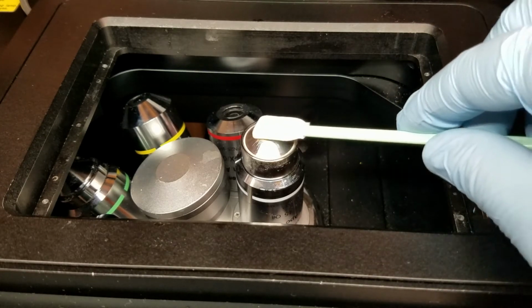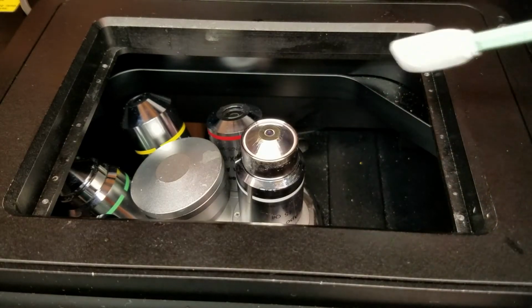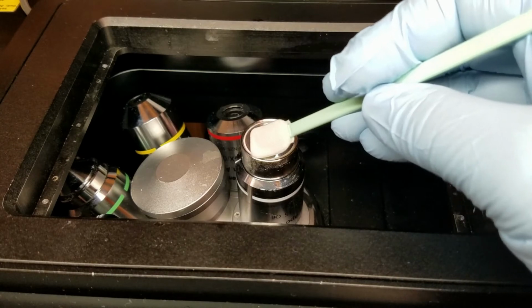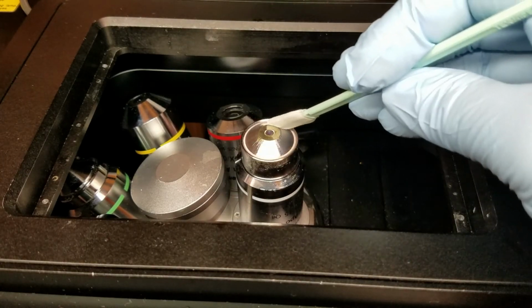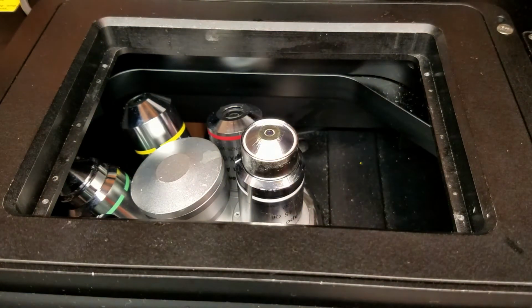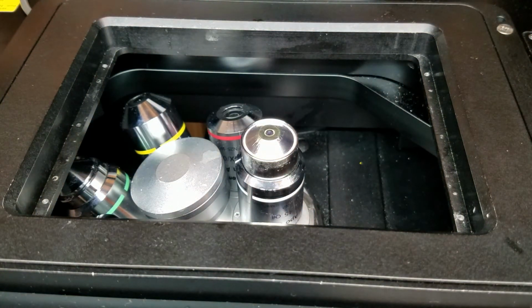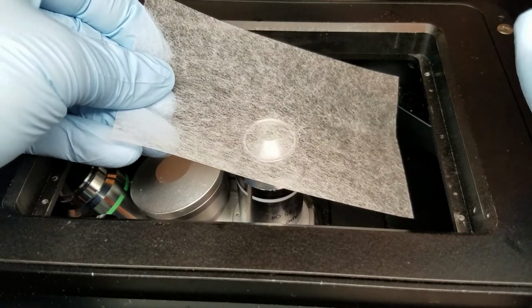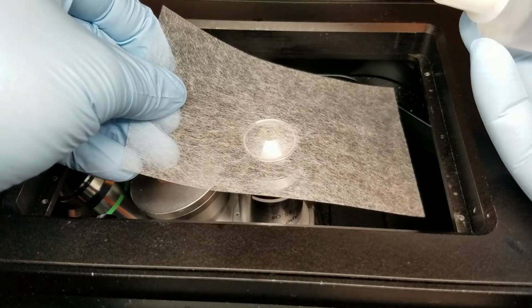I do this because the Nikon oil is quite tacky and it's hard to get off with just lens paper. Then I use the same paddle if needs be, and I go around, make sure I get everything out of the well in case there was any oil there. Then the last step is to grab another piece of lens paper, and this time make sure we're using the ethanol. And again, you may not be able to use the dropper bottle if it's not in the room. You may need to use a squeeze bottle.